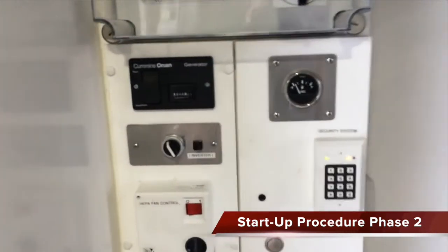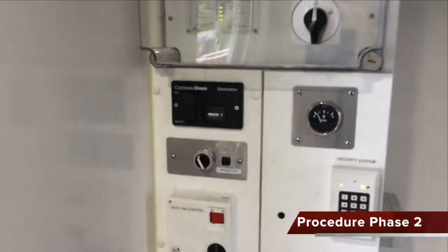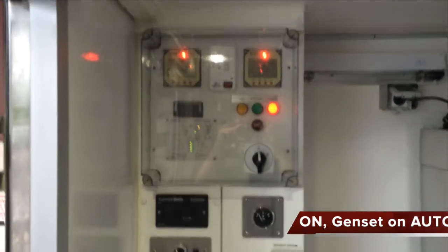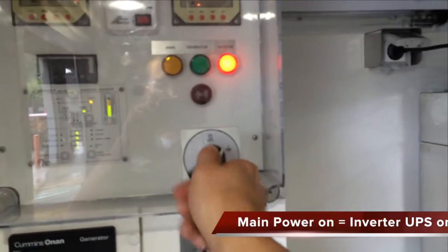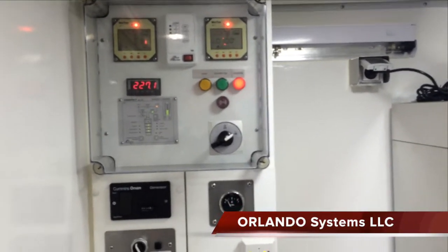In order to start the lab, simply turn on the inverter and wait for the inverter indicator light to start. At this point the inverter is activated. Switch the main disconnect to on and your interior lights will turn on. You're now running on inverter power inside the lab.